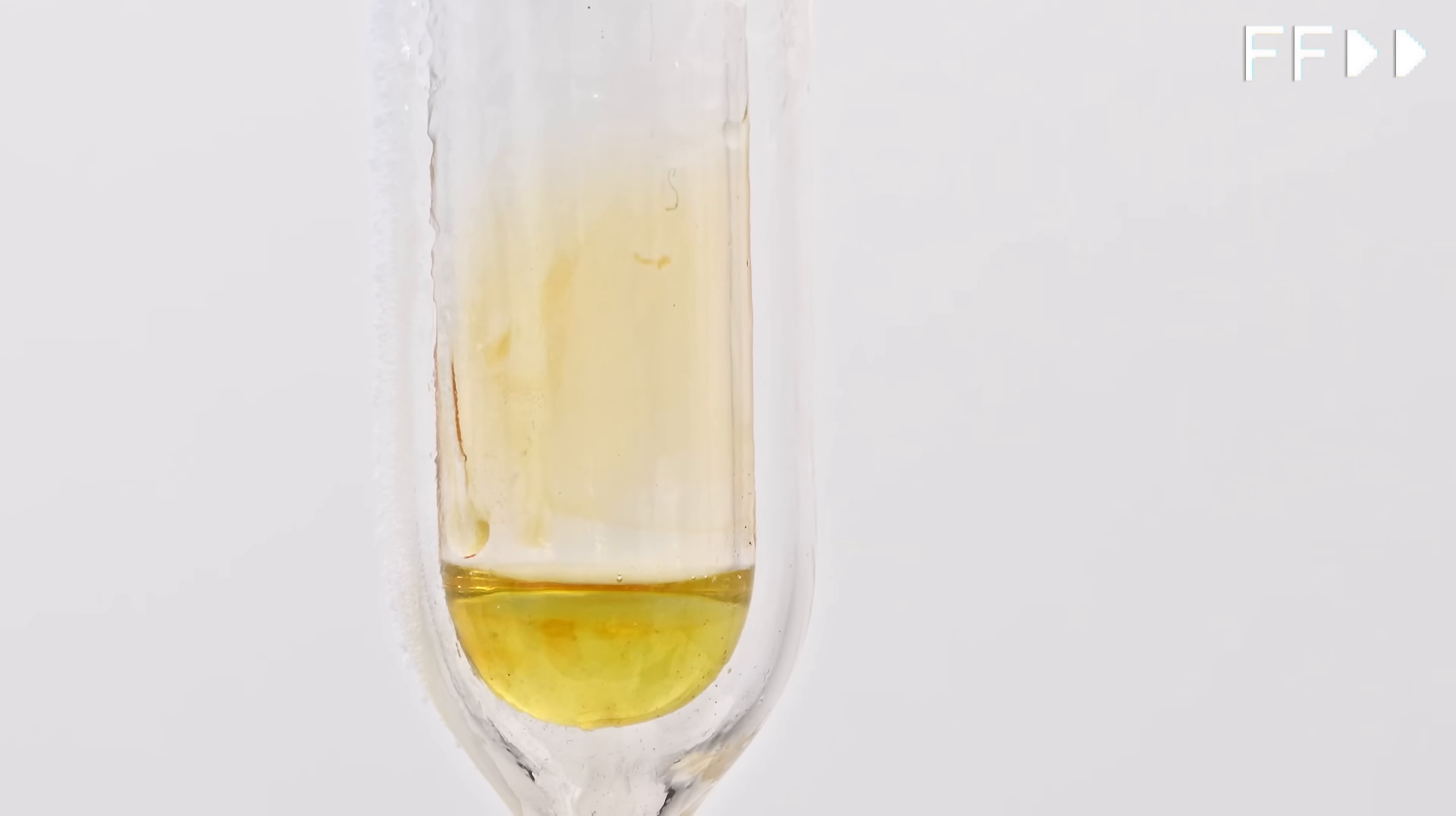Interestingly, as the temperature rises and the red color fades, a bluish tint begins to appear. What do you think this could be? A solution of nitrogen oxides and ammonia or something else? Let me know in the comments.